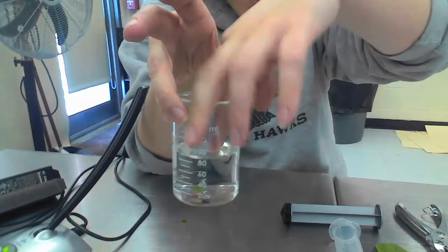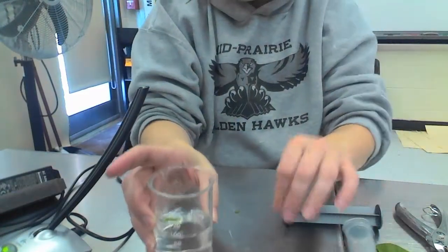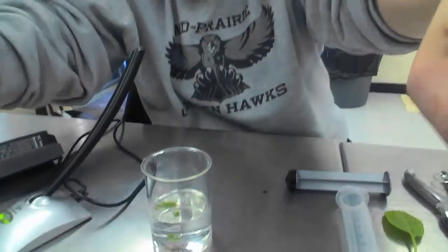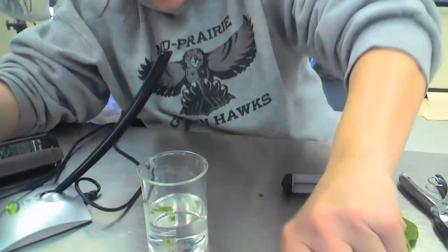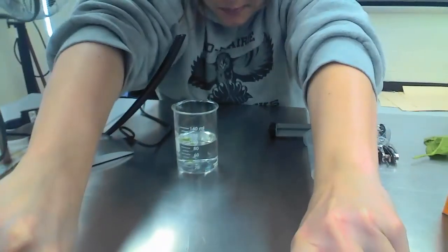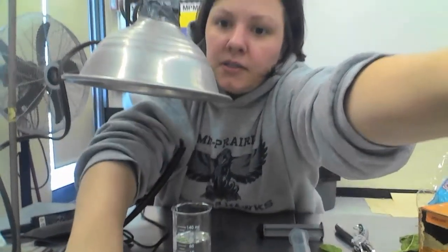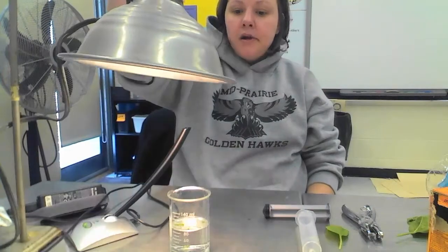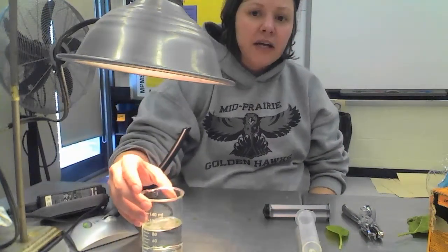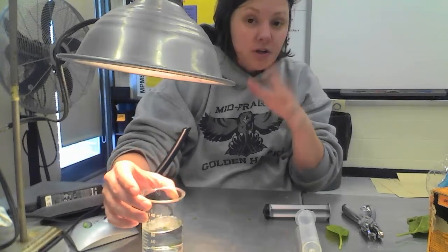And then we're going to put them in the light source. That one I didn't get all out. So we're going to put it into the light source. Now you're going to have this light source, and I don't know if y'all can see very well, so I'm going to push the camera back a bit. So I have my light source right here. But the problem is if I turn this on and put this over here, it's going to create a lot of heat for this plant, and that's something we don't want to have.